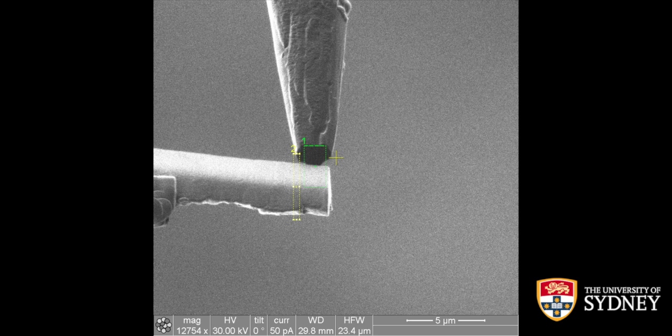In the microscope, the whole thing will look like this. You're seeing the support structure, which is a molybdenum grid in this case, which is being cut at an angle, and the lift-out bar. The green box on there, on the FIB instrument obviously, is the position for the gas injection system, and the yellow box is the cut that removes your little lift-out piece from the rest of the bar.